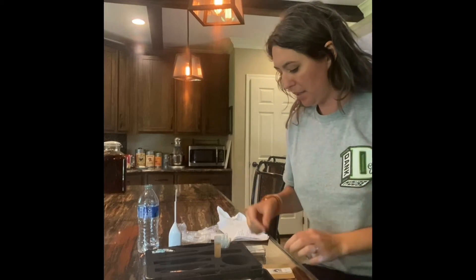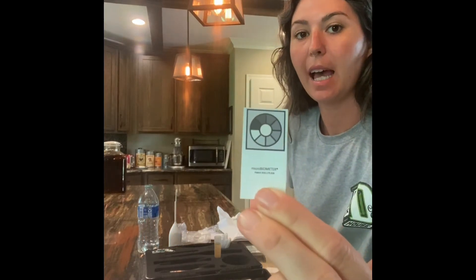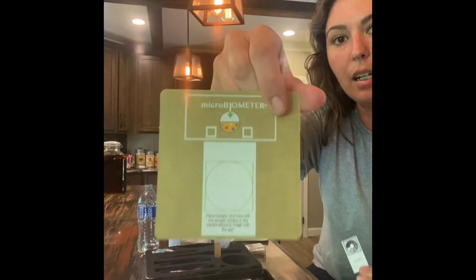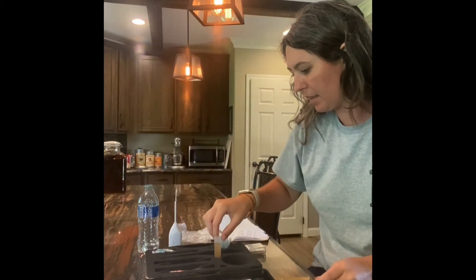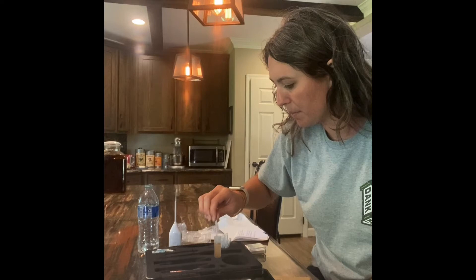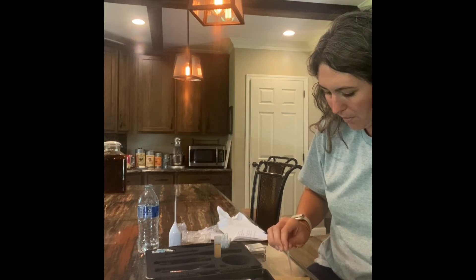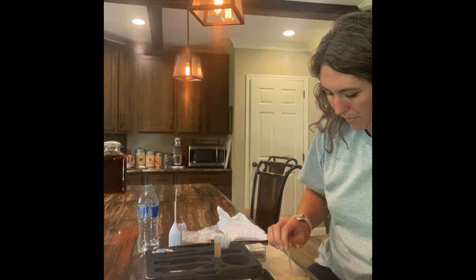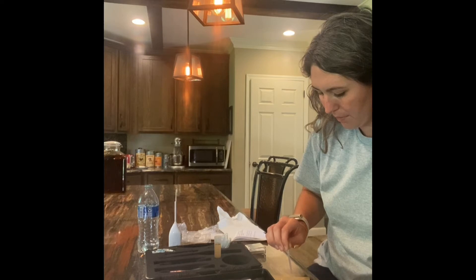It's been about 15 minutes, so we're going to take one of these microbiometer slip samples and set it in the square. We've got that set down. Take a little pipette, dip it into the water — be careful not to pick up any organic debris — and we're going to drop 3 drops into the center: one, two, three.